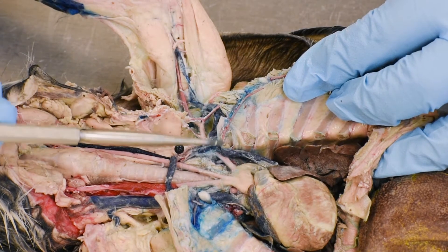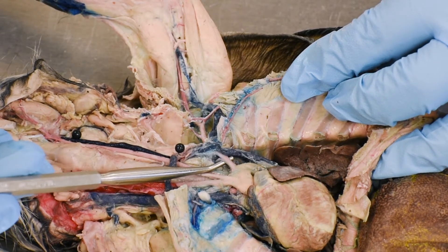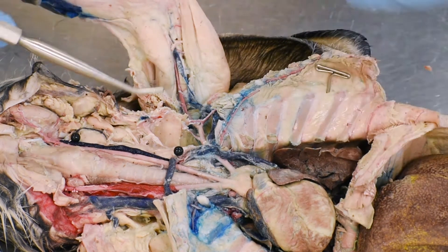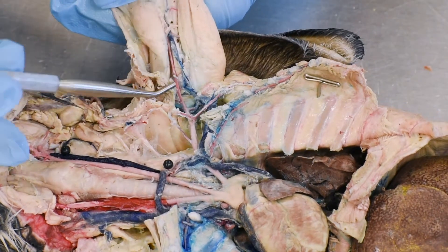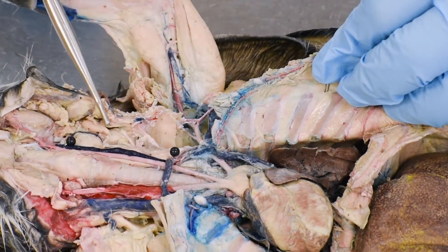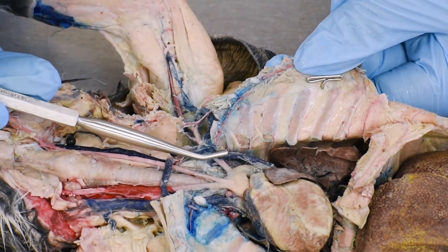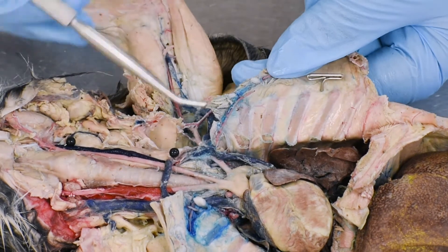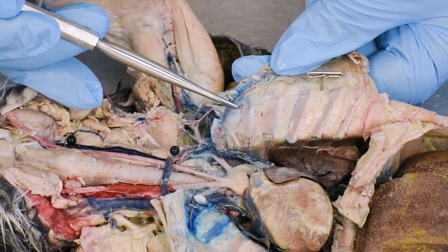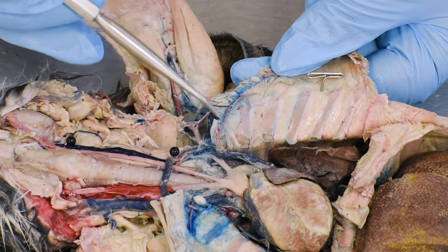In this section, we will start with the left subclavian artery and then follow along the thoracic area to the brachial part. There are branches, very intricate in a number of different directions. When we open up the thoracic cavity from the subclavian, there is a branch called the internal thoracic or mammary artery.